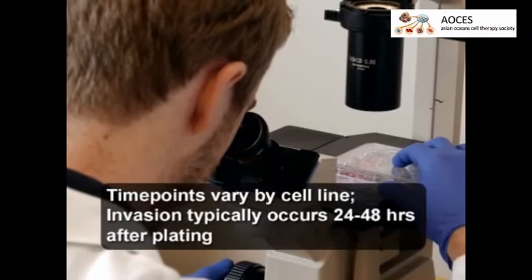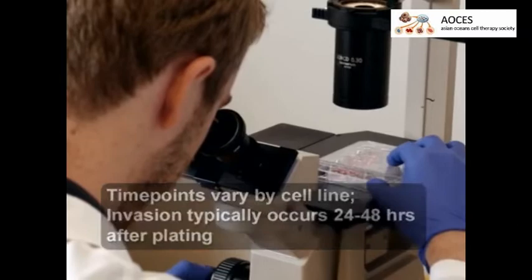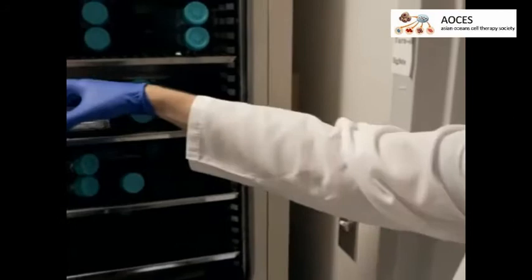Using an inverted microscope, image the invading cancer cells using the 20x objective at predetermined time points. Incubate the dish at 37 degrees Celsius in between imaging time points.